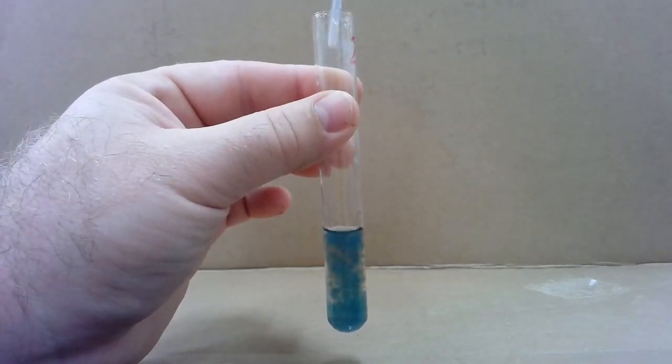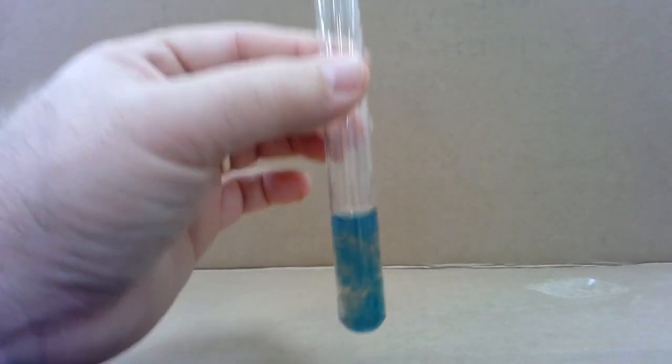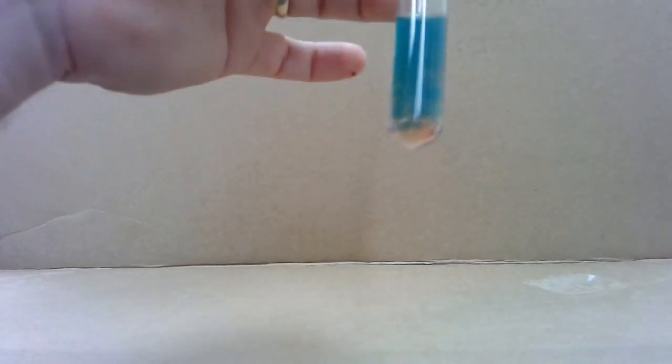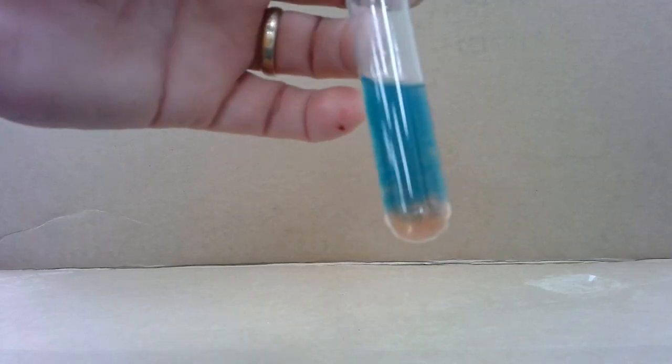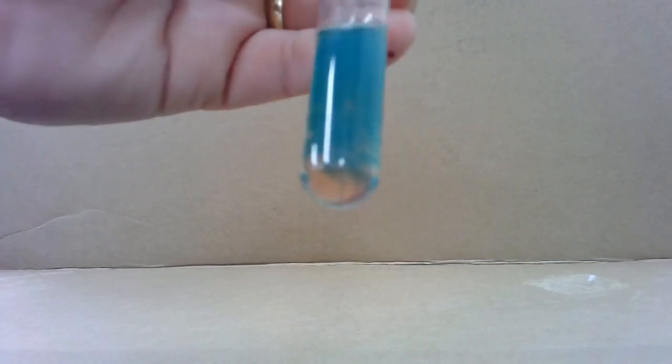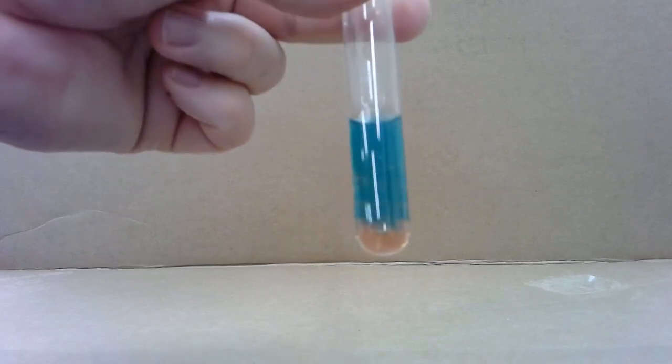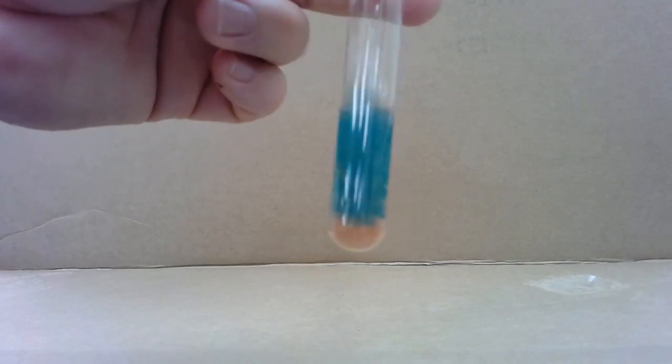Well, it appears that we have a bit of a color change. It was pink. Now it's kind of blue. I hope you can see that. And in addition, it's gotten kind of chunky. It is no longer see-through. It is a chunky blue forming there.